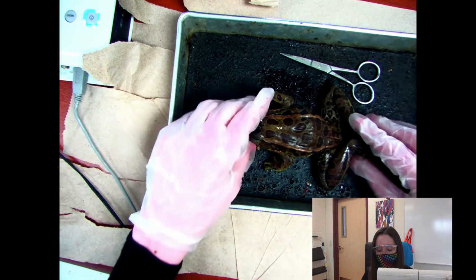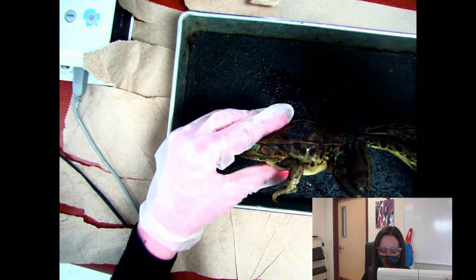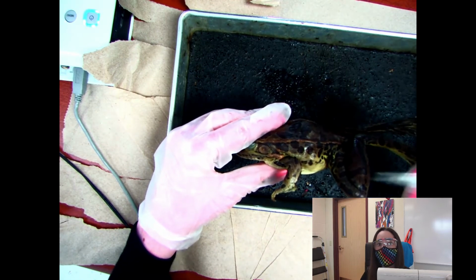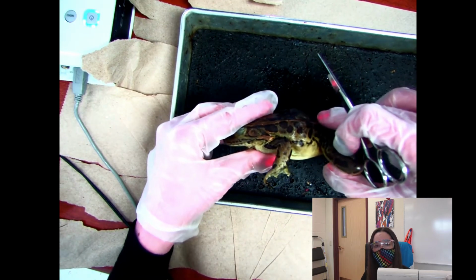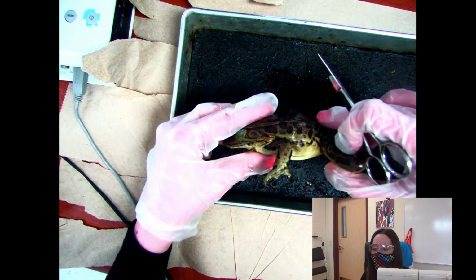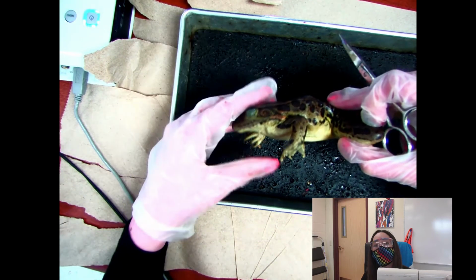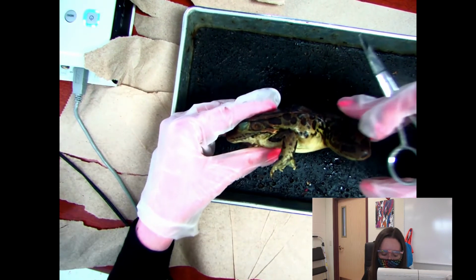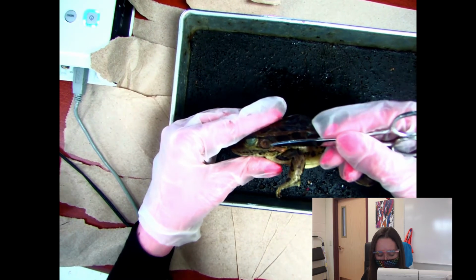With this video, you can rewind it, you can fast forward, you can make me talk faster, whatever you need to do to help you remember the parts of the frog. And this will help you be successful on the quiz. I also made a Quizlet for everyone so that you guys could look at that as well. So you have a lot of different ways to learn the frog parts. Hopefully what I give you can help. So we're going to go ahead and get started. I hope you guys are all doing well today.